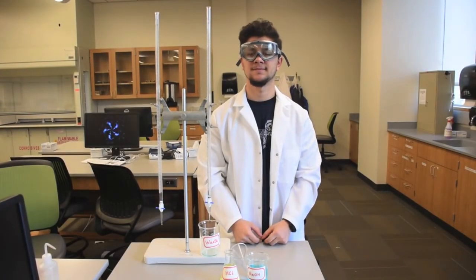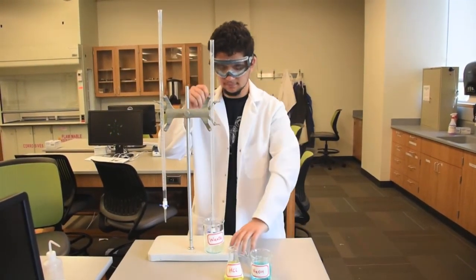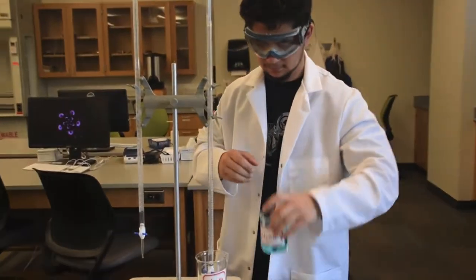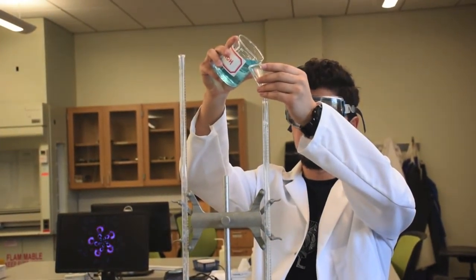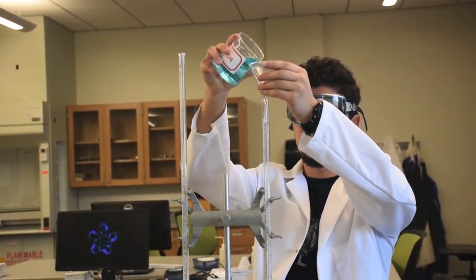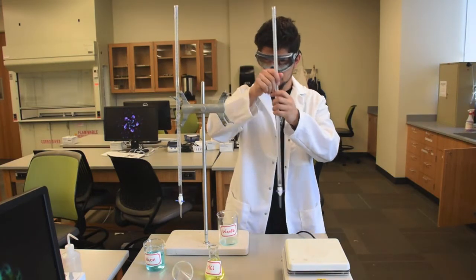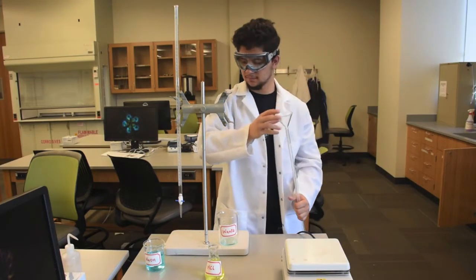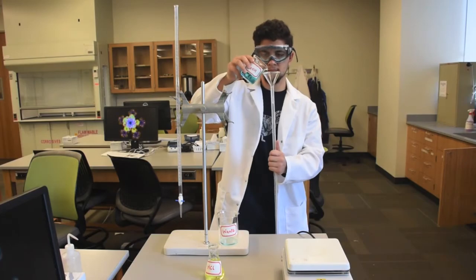Once you are finished with washing, you are now ready to set up your burette. Using a long stem glass funnel and sliding the burette under eye level, carefully pour your titrant into the burette to the desired volume. If you cannot get the burette to eye level before filling it, you may remove it from the clamp and hold the burette to eye level instead. When doing this, make sure you are very cautious about spilling any titrant on yourself or others.